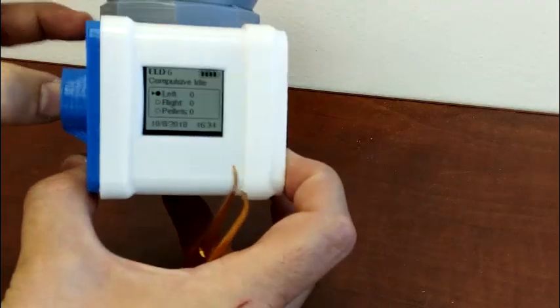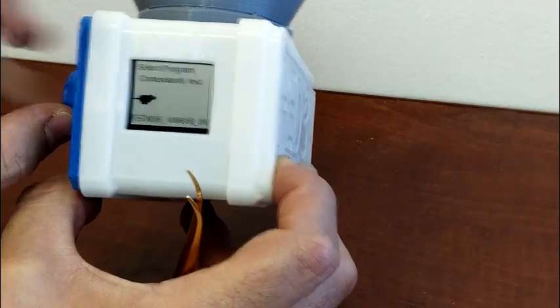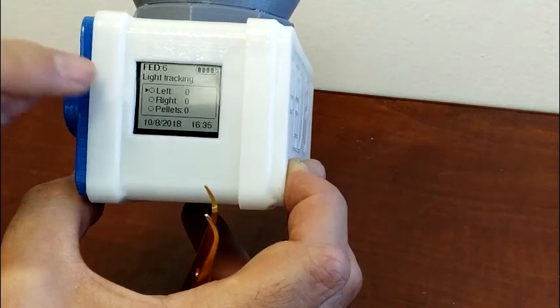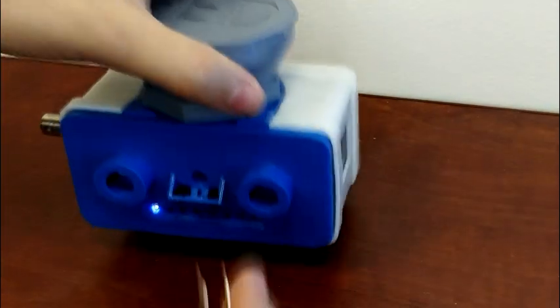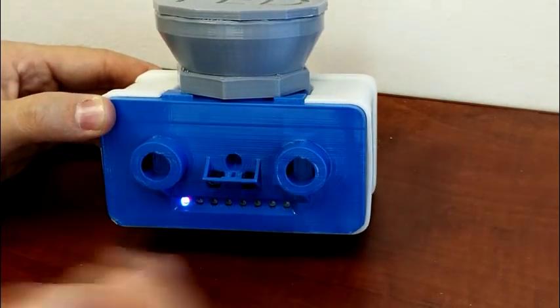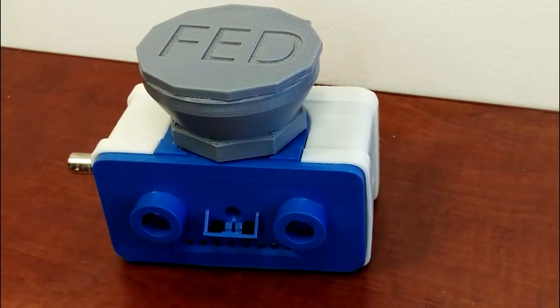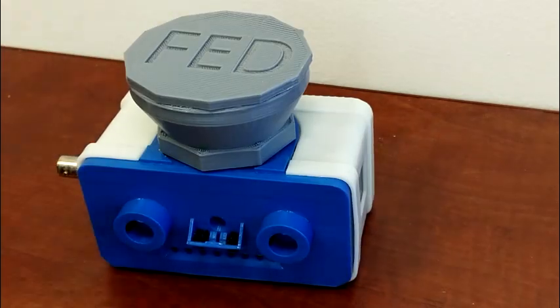The next one we're going to look at is a visual tracking test that I'm calling light tracking. In this task, you'll see the left arrow or the right arrow determining which poke is active. It's an FR1 task. And we can see that there's an active poke. So if I poke on the right, no pellet. Poke on the left, and we'll get a pellet. When we take the pellet, it's randomized on each trial as to whether the left or the right poke will be active.